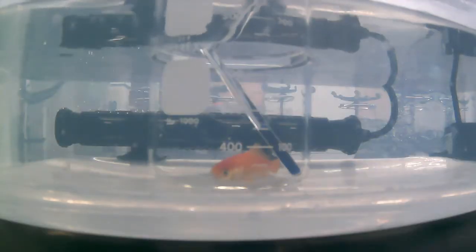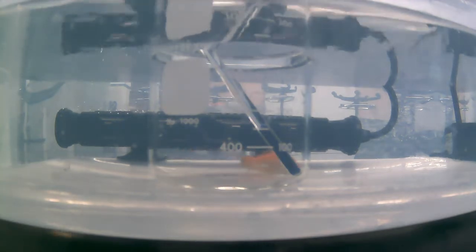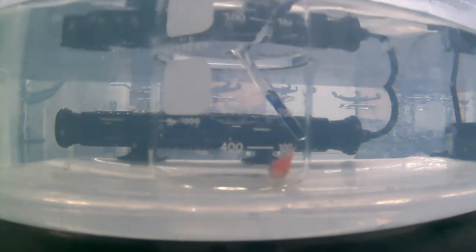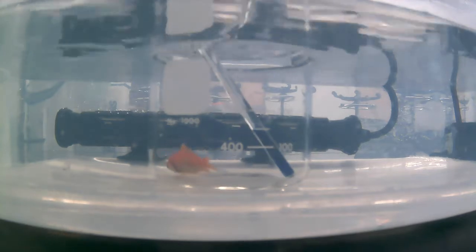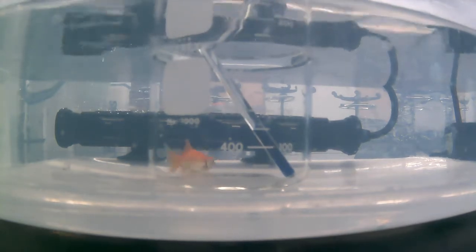Alright, we are now hitting some major muscle spasms, and he's starting to lose his equilibrium, so we're going to call this guy too. And he came in at a whopping 39.1. So this little guy made it quite a long time. So we're going to log that final temp for you guys, and we're going to wait here for Dr. Bennett to come back for him to make some potential conclusions from the temperature changes. So we will be back with Dr. Bennett shortly.